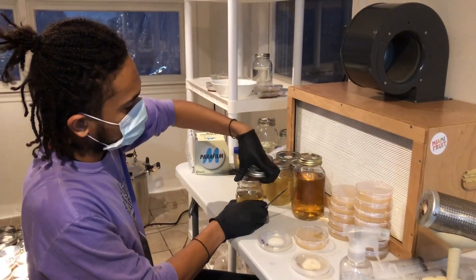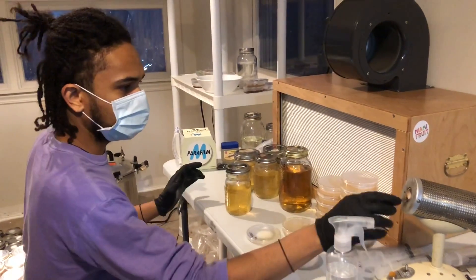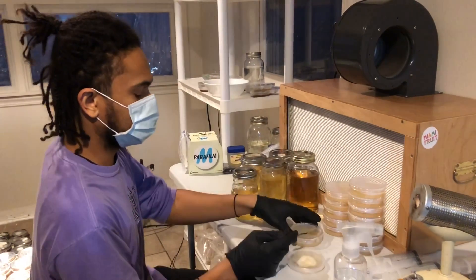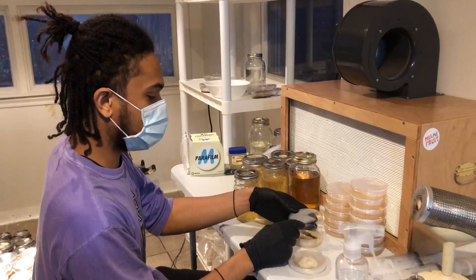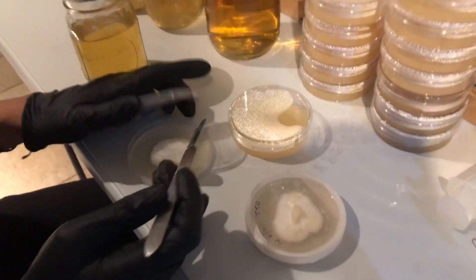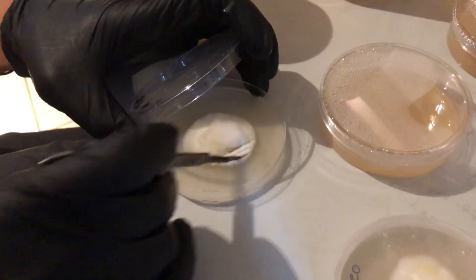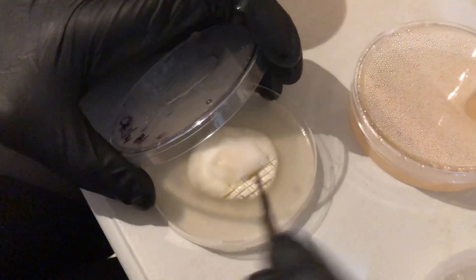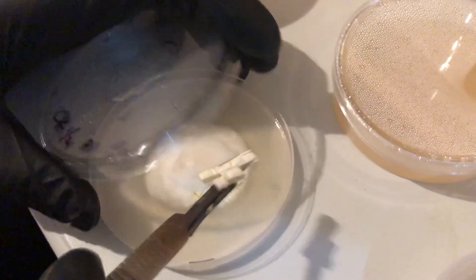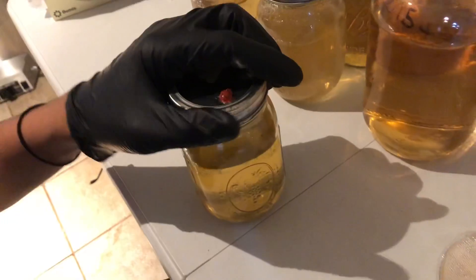I'm going to go ahead and open that up just a little bit, make sure it's easily ready to open, heat that up one more time. I'm going to dip it into this clean agar to cool down the blade and make sure I don't burn the mycelium. I'm going to go in here and cut some slices, cut some crosses, get it all nice and sliced and diced. Then I'm going to take these little pieces and chunk them right into the liquid culture jar, put the blade back in the sterilizer, and just do it all over again.